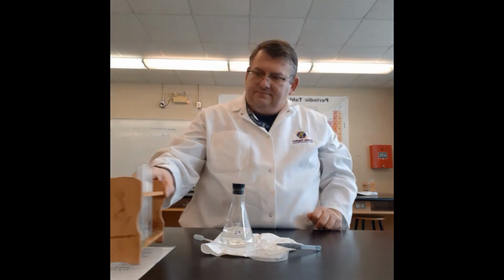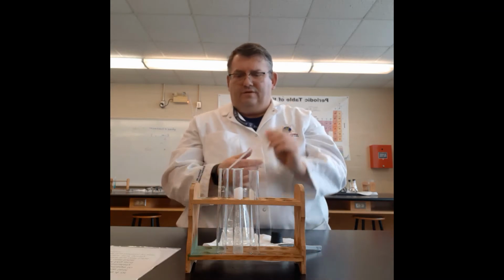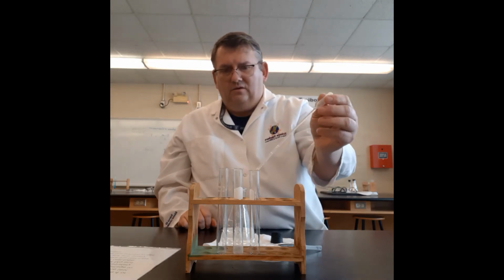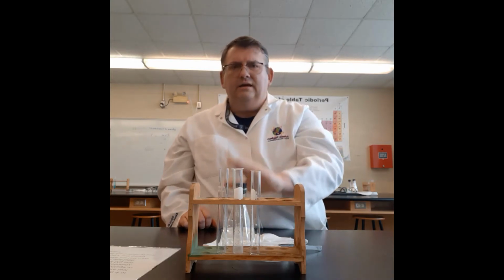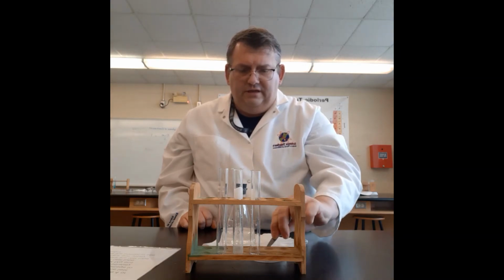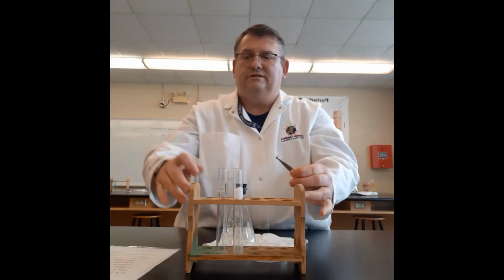I'm going to take a test tube and add in a pipette of 4 or 5 droplets of the hydrochloric acid, or the HCl. So we've got 1, 2, 3, 4, 5. Put the rest back in here and put the cover back on. Now I'm going to drop in a part of the magnesium, and we're going to see what kind of reaction takes place. We're going to put it in the test tube, swirl it around, and then gently feel the bottom to see if there is a reaction.